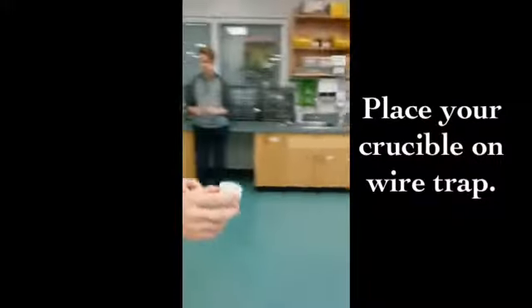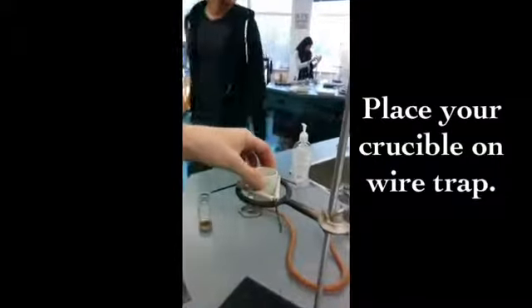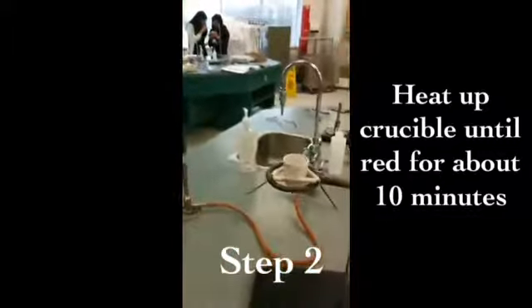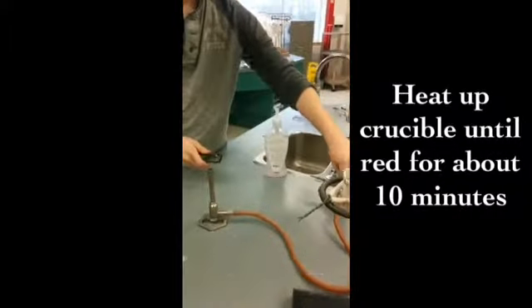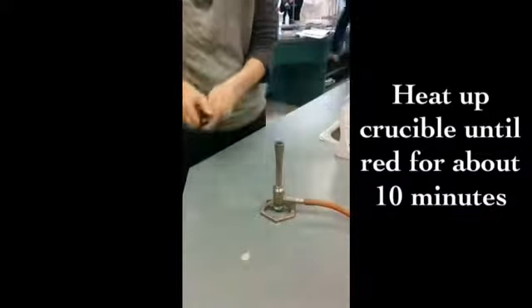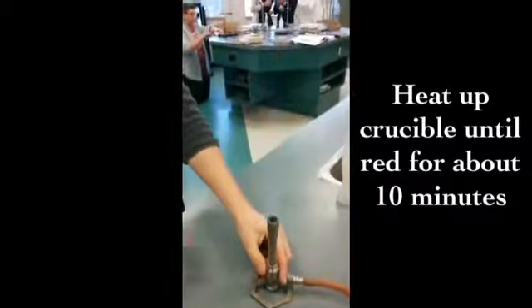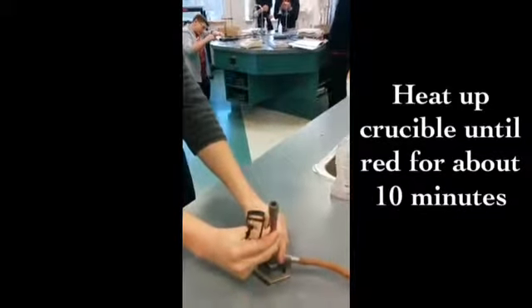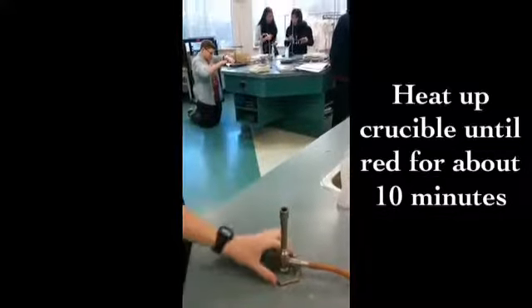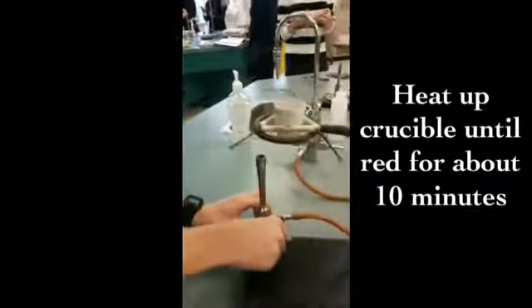And now we have to place it on the wire triangle. Now that we've got our crucible nicely adjusted, it's time to light the Bunsen burner. If the crucible is cracked by accident while you keep it in, it will fly everywhere, and you don't want it to fly into your eyes. Now that it's lit and adjusted, let's put it under the crucible. Be really careful.